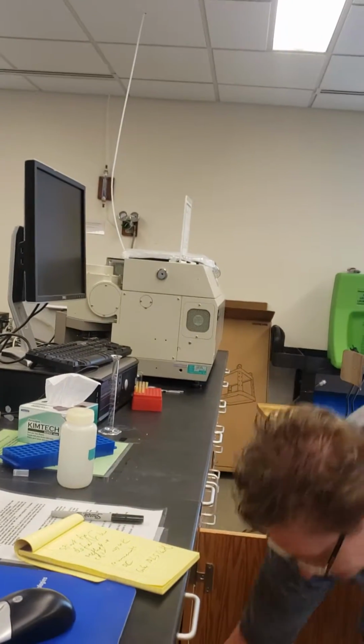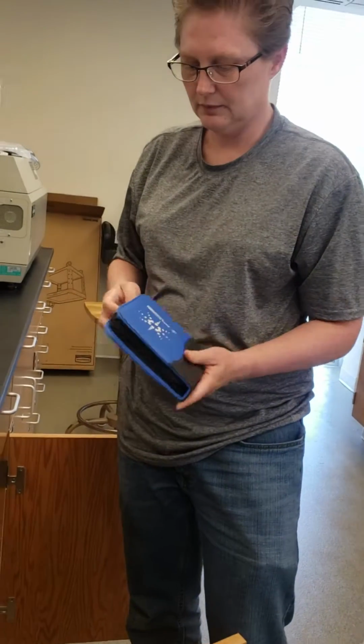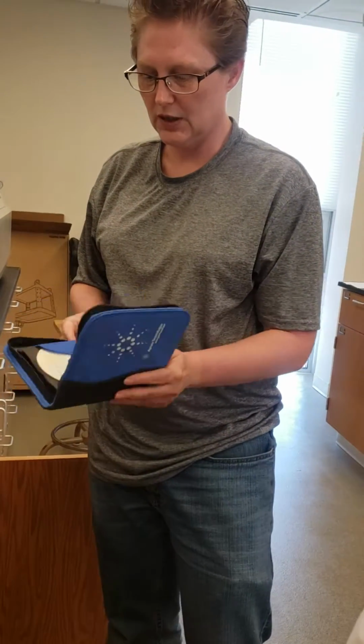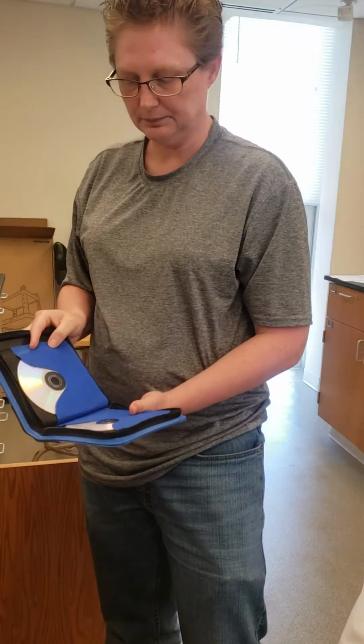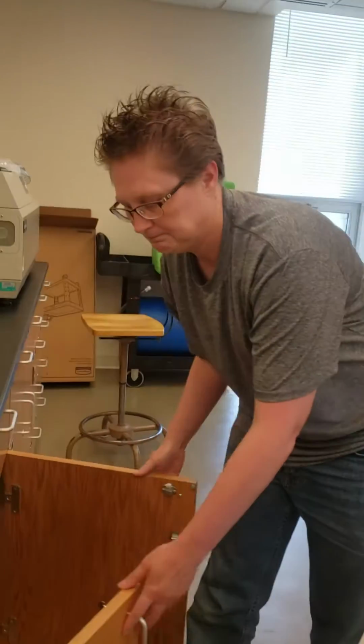Down here, in the ASM. These are data that Annette moved over. Oh, all right. So we can access them from there. If it was several years ago, it might be in those. Oh, all right. So if I don't find it there, they might be there.